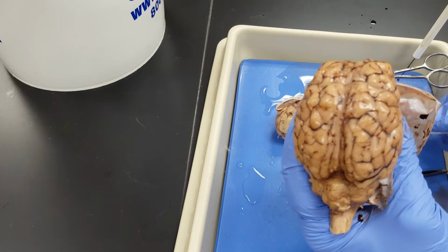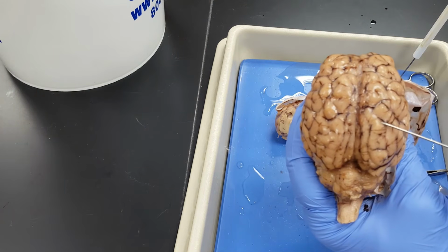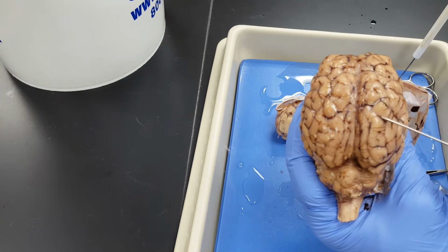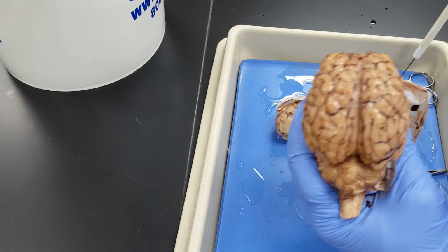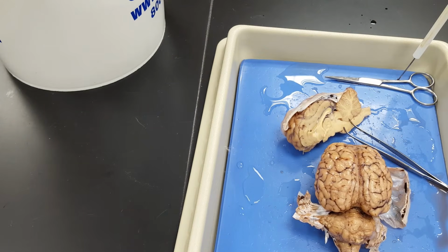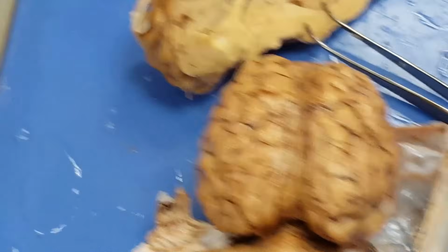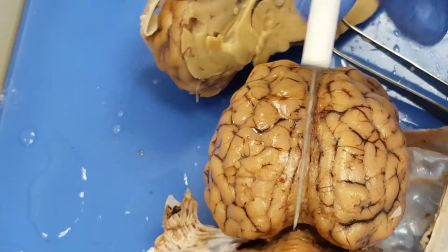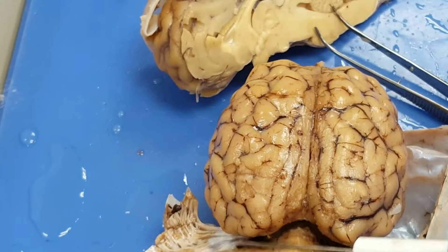On the surface of this brain, I can see what? See it, the darkly staining, because there's some blood vessels down there. Sulcuses, the sulci, and then the raised portions, the gyrus. Now, I can try to zoom in a little bit for you. So I can see very clearly the longitudinal fissure, right there.